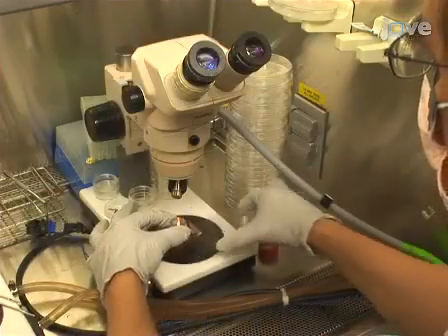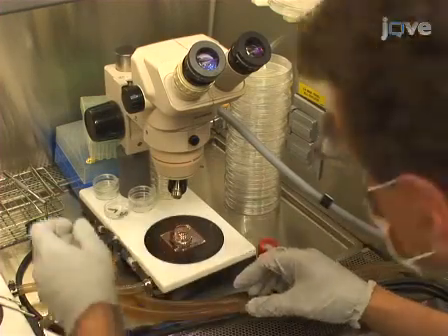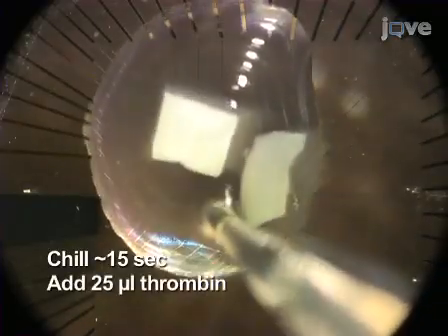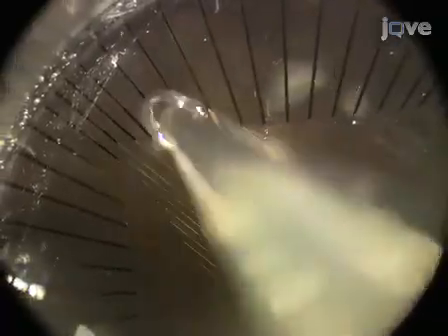Now place the MEA on a cooling plate and refocus the view. Allow this to chill for about 15 seconds before adding 25 microliters of thrombin into the plasma droplet. Then, using the thrombin pipette tip, carefully spread the plasma thrombin mixture with small circular movements across the MEA. Be careful not to touch the brittle electrode array directly.